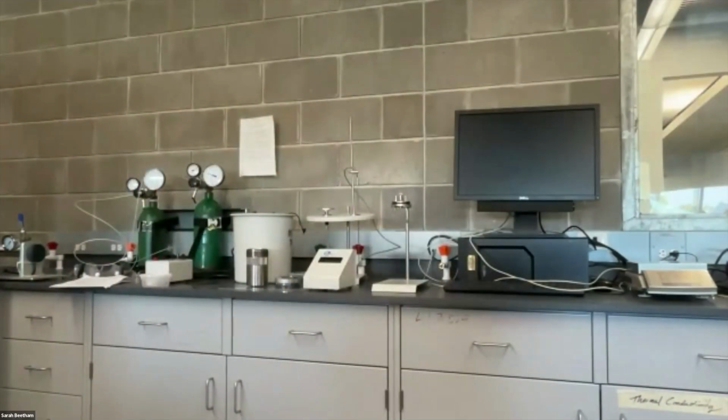So that is up in the front of the room. Use a graduated cylinder to fill this up. The TAs should be keeping an eye on these being full. If you find that you come here and they're getting low, or they're getting low by the time you are done with the experiment, can you please email them and let them know to refill? Each of these is 1,000 milliliters, so I'm going to fill this up twice and then put it into the water bath.